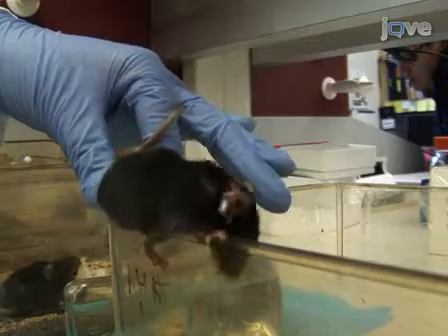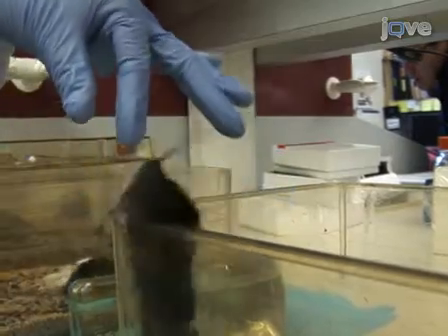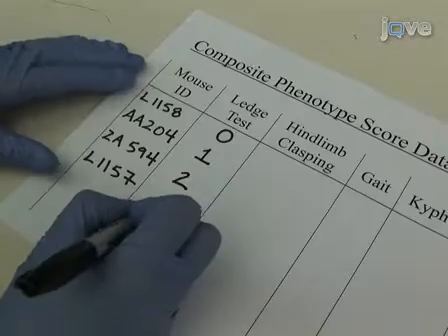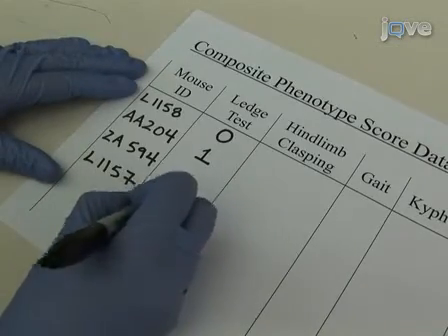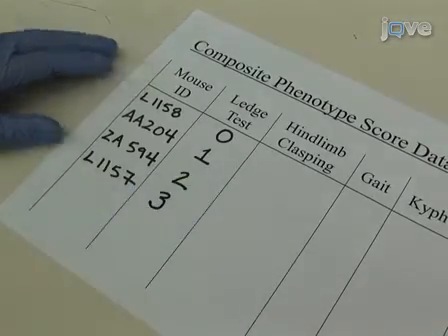Conduct the ledge test three times to ensure an accurate measurement and record the ledge test score. Now let's see how to score hind limb clasping.